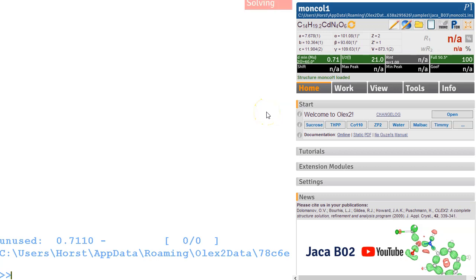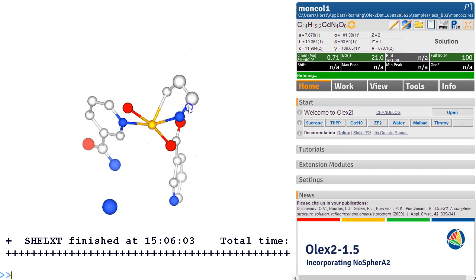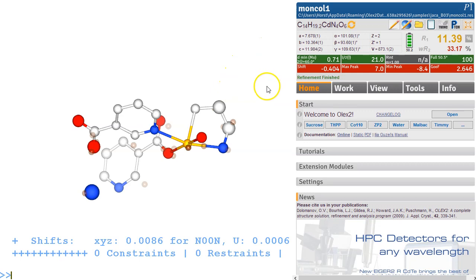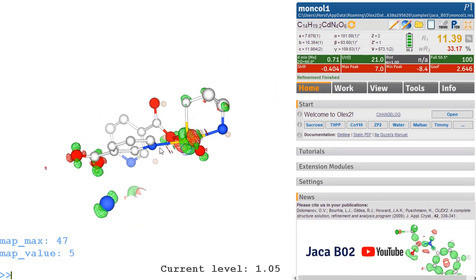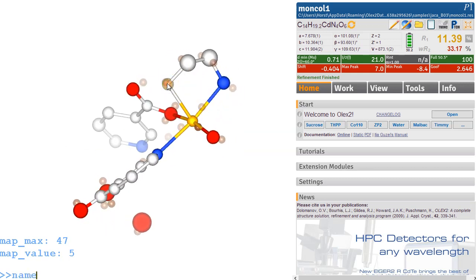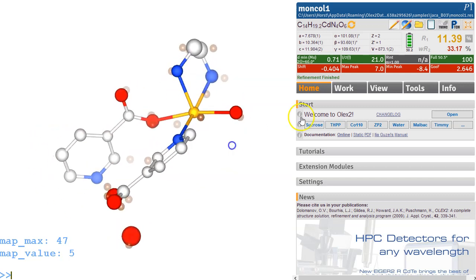Let's solve it. Solve the structure. ShelXT gives us the atom type assignment of sorts. I suspect that that is an oxygen. So let's just refine it so it's maybe easier to follow. So Control M will also tell us a few things here. So first of all, obviously this could be an ammonium, but it's almost certainly a water molecule. And this one here will be a nitrogen atom, and then we may have a nitrogen in that ring.